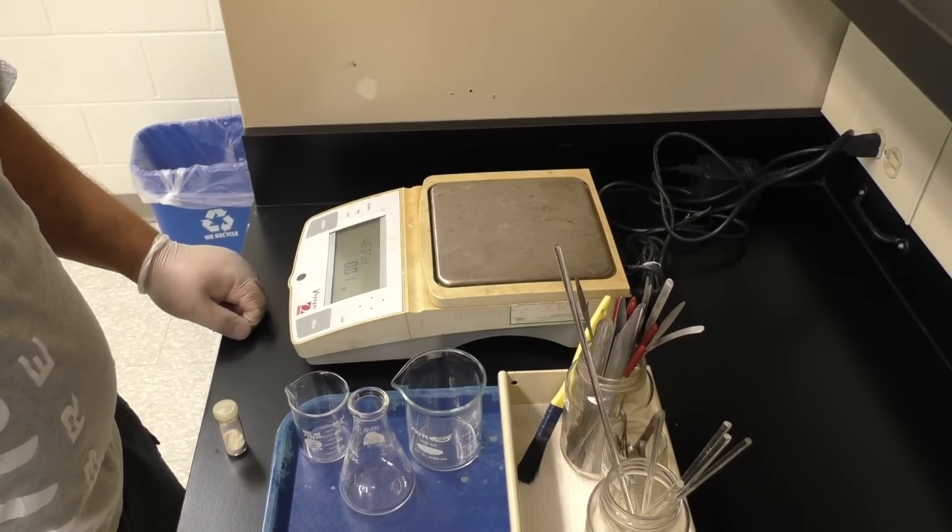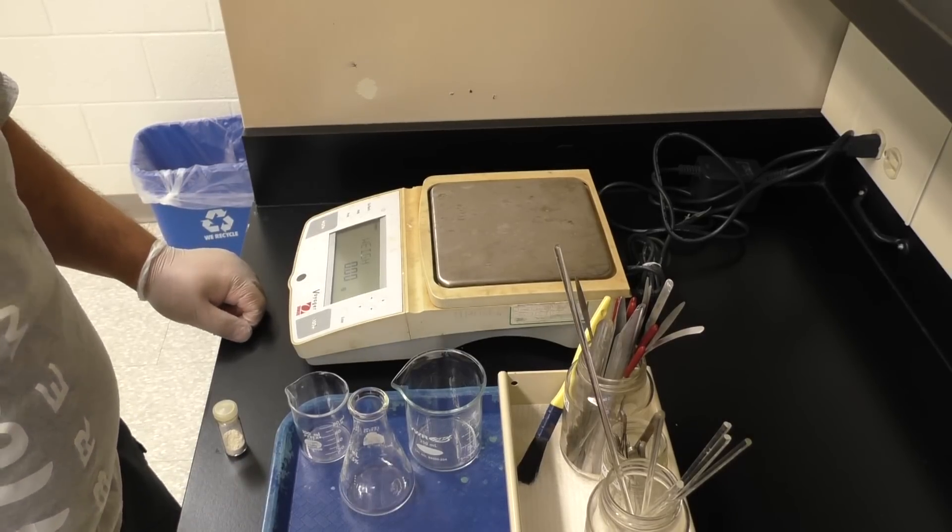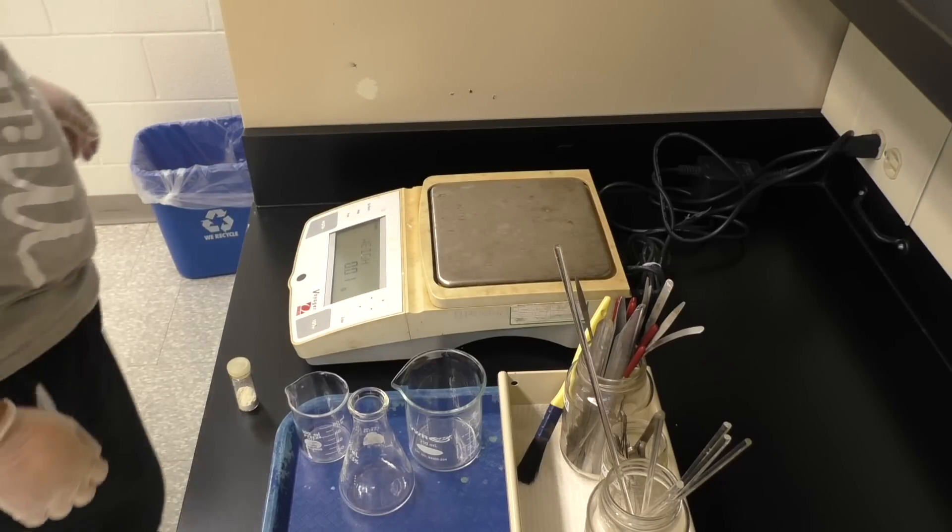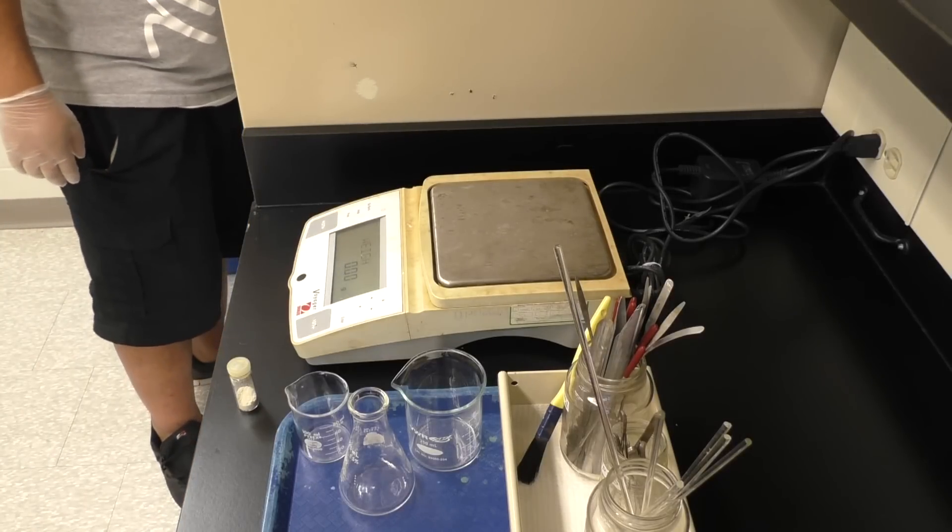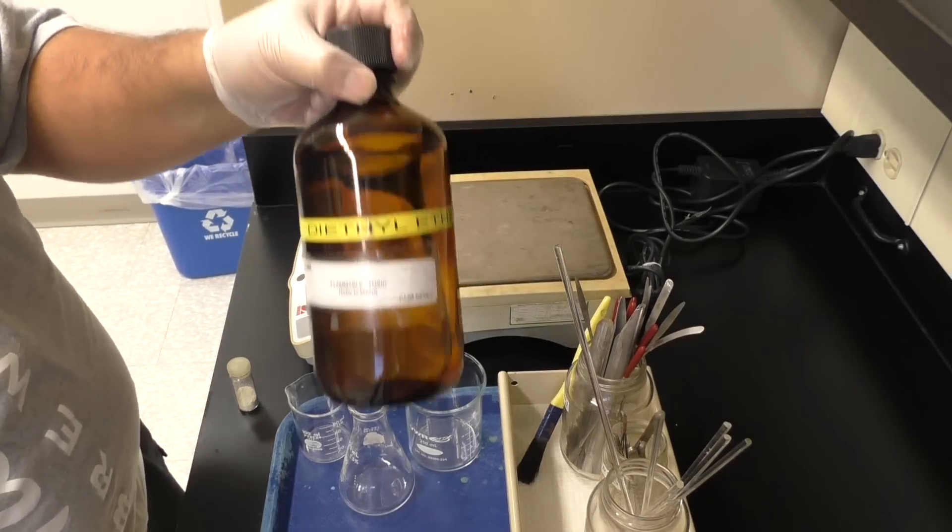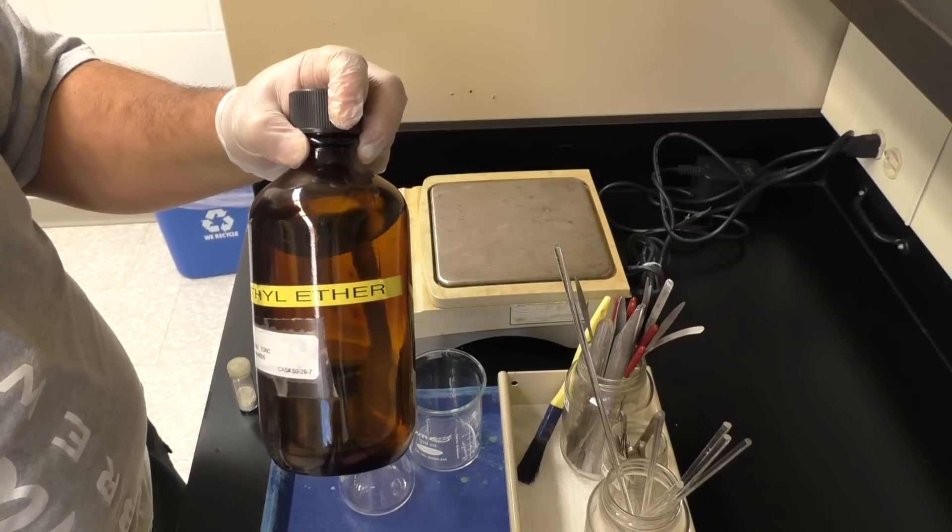A couple beakers, Erlenmeyer flask. Anyway, what you should do is we're going to do, we all know sort of weighing by addition, where you'd put your stuff onto a sheet of paper or whatever and get its mass, we're going to do weighing by difference.